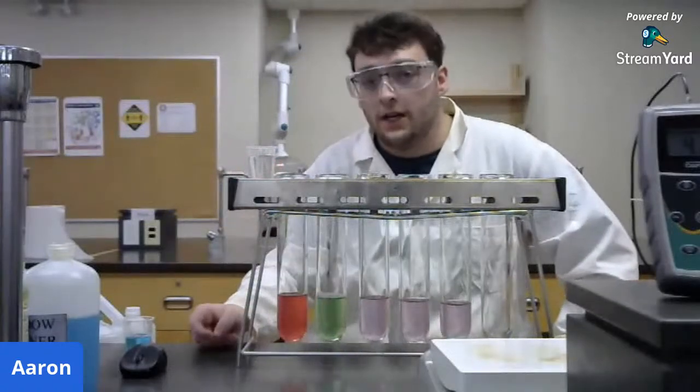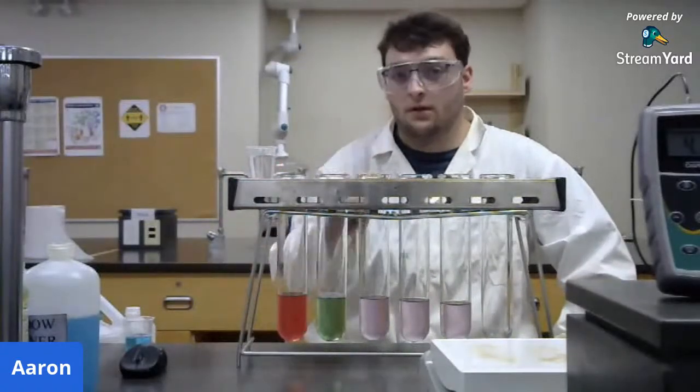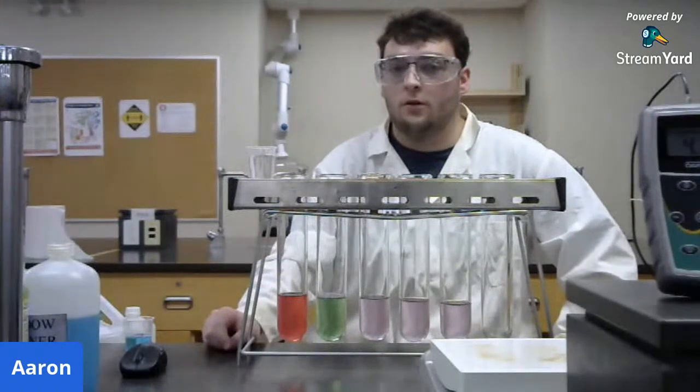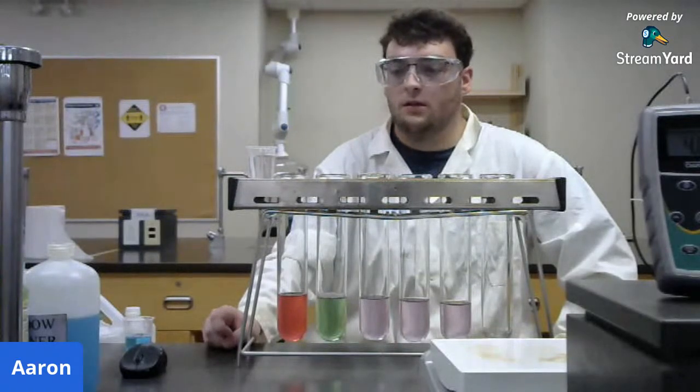Remember not to ever drink anything in the lab. It's an important point. Never put it in your mouth. You never know what could have touched it, especially during these times. Don't want to get sick.